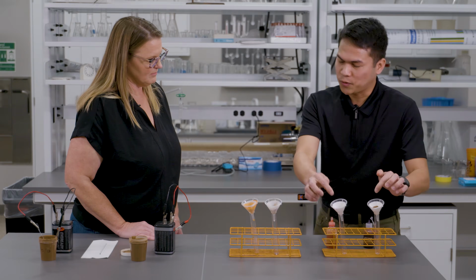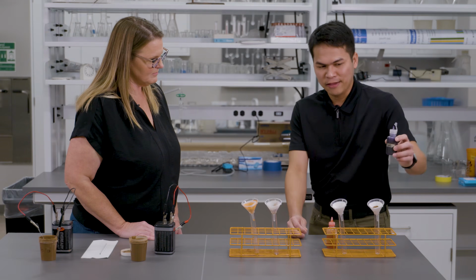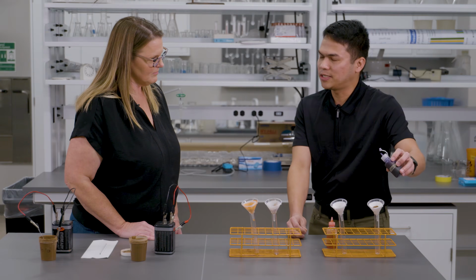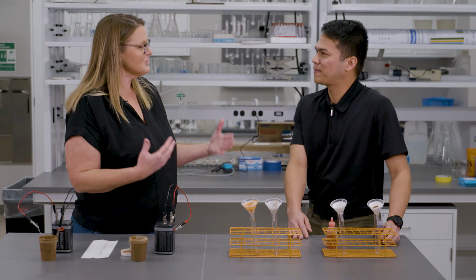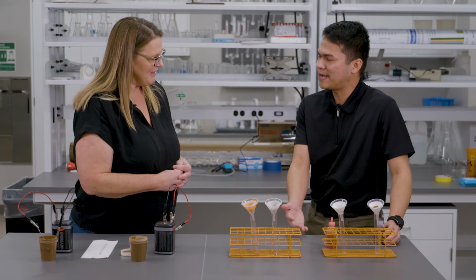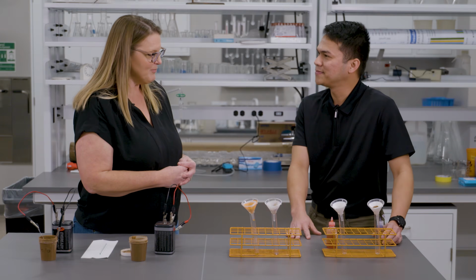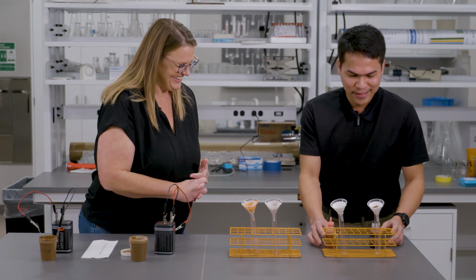Now, we have a soil. If the net charge of the soil is really negative, and if we add this positively charged dye, what will happen to the leachate? Well, what do you think? Magnets, right? Opposites attract. Yes. So what will happen? Will it be clear or just remain purple? I'm going to say it's all going to stay in there. Well, we'll see.